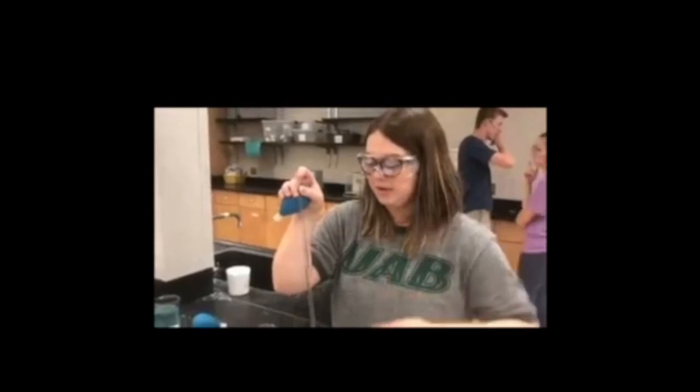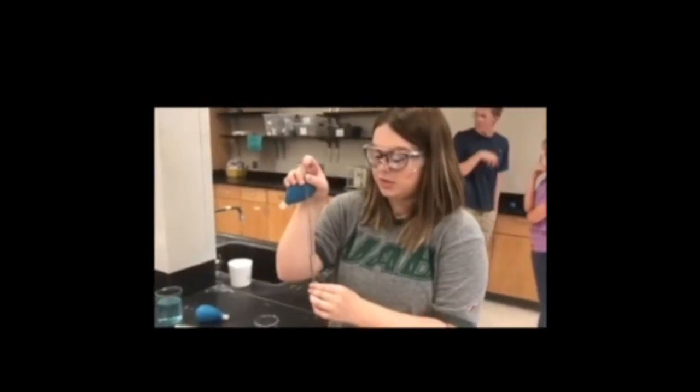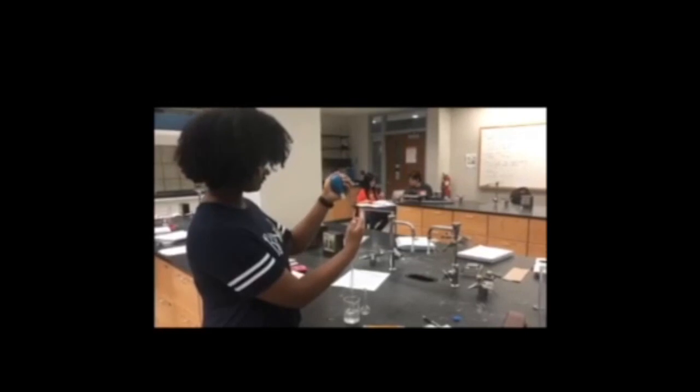After recording the volume, place the pipette into the beaker you want to fill with the solution. Then release your finger from the pipette to let the solution go into the beaker. Place your finger onto the pipette again if you want to stop the flow of the liquid into the beaker. When repeating this process for the experiment, make sure to have each lab person perform the experiment in the exact same process in order to get an accurate set of results for the experiment.